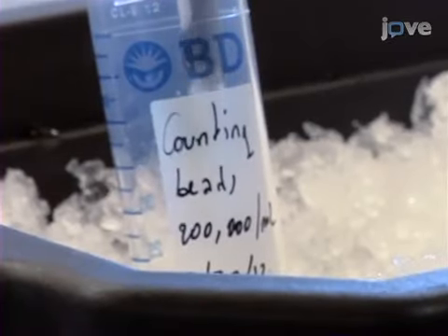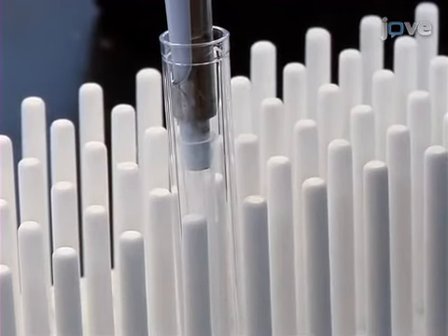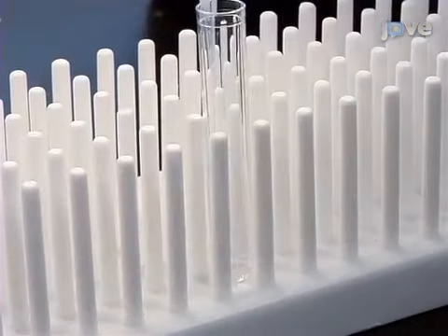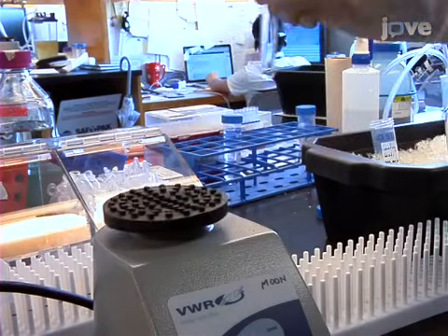Before staining the cell fractions further, add 200 microliters of counting beads into a 5 milliliter FACS tube and transfer 5 microliters of cells into this tube. Set these tubes aside at 4 degrees Celsius for analysis later.